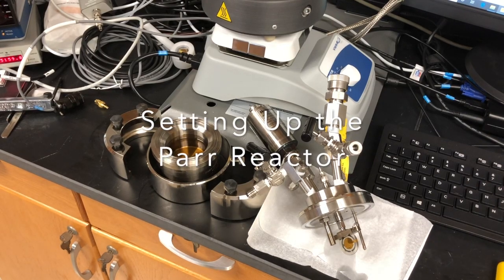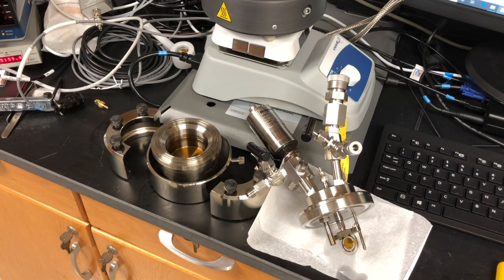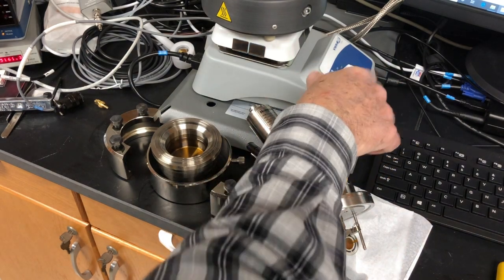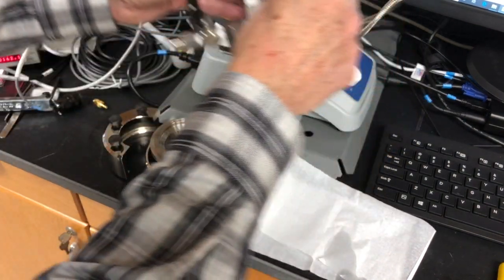Now that the QCM crystal is installed in the adapter and we have loaded 60 milliliters of fuel, we can set up the Parr reactor.